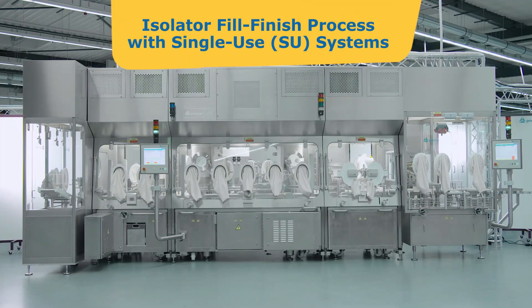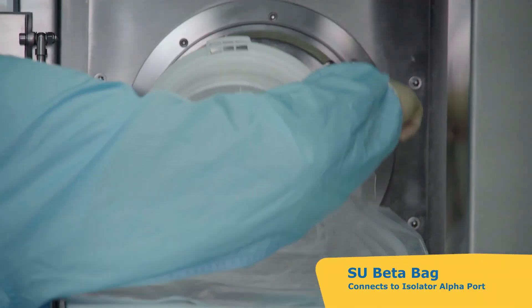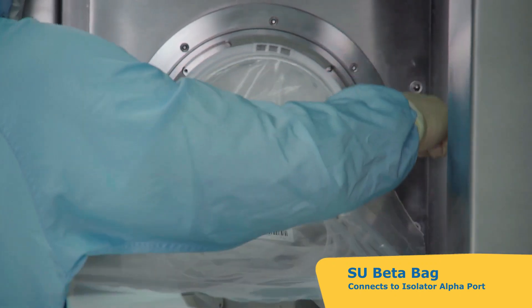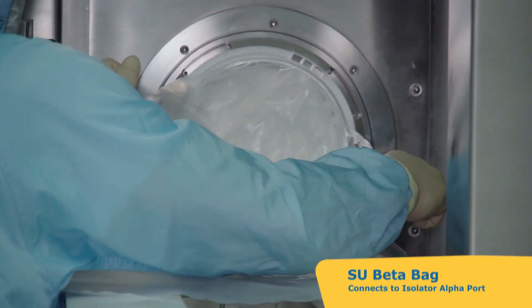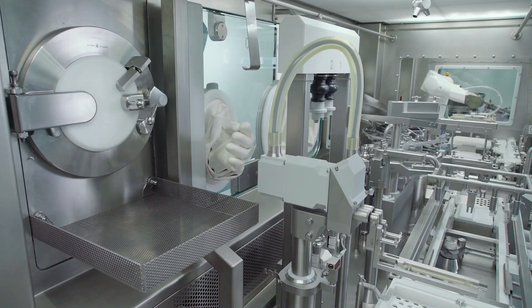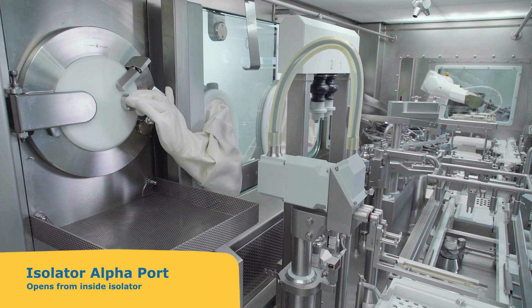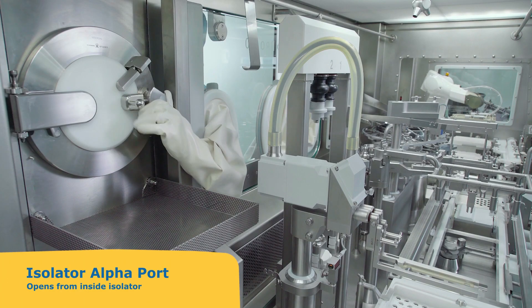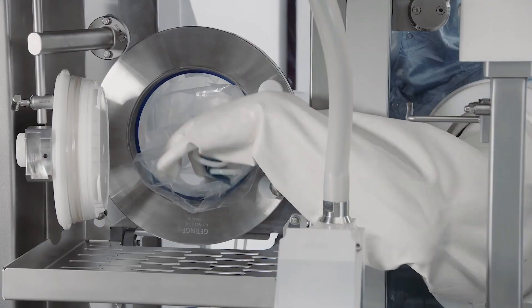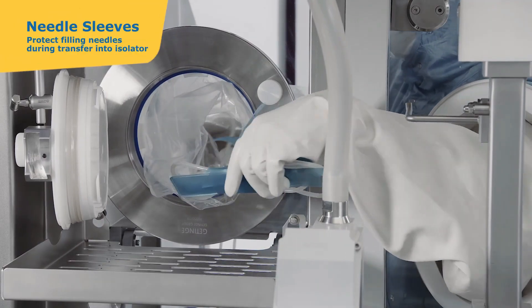Isolators — Design and structure. Isolators provide a completely sealed, fully closed environment where the operator cannot physically enter the system. Operators interact with the internal environment through glove ports or mechanical devices. Isolators maintain a continuous overpressure — positive or negative — depending on the application.